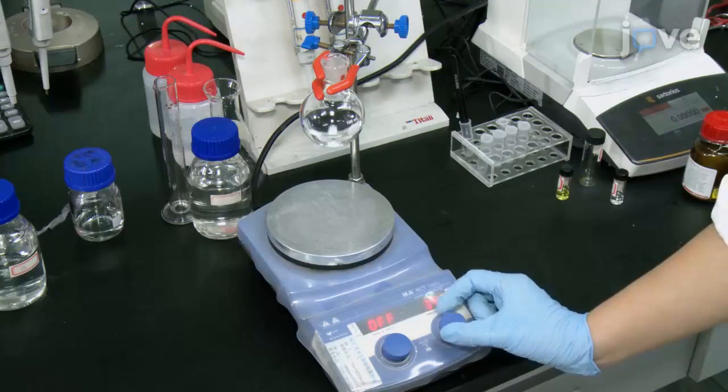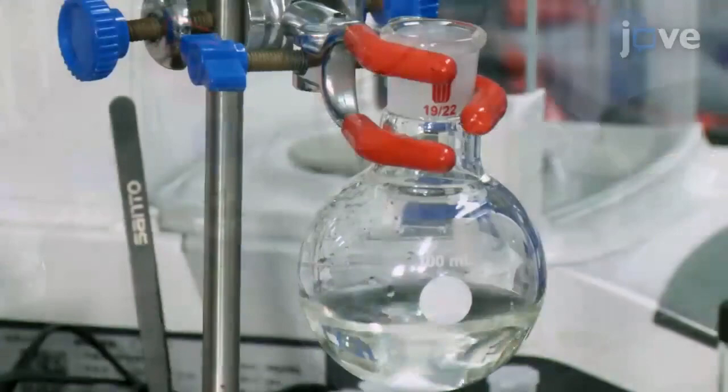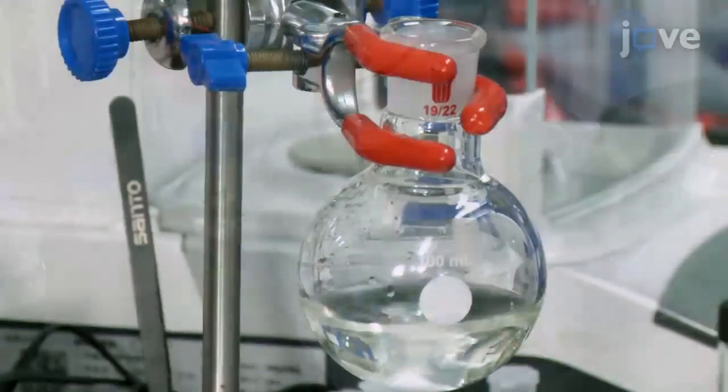Ensure that the pale yellow reaction mixture is stirring vigorously. Quickly pipet the sodium borohydride solution into the vigorously stirring mixture, which will immediately become bright orange. Continue stirring the mixture for 10 minutes to obtain the gold nano-particles.